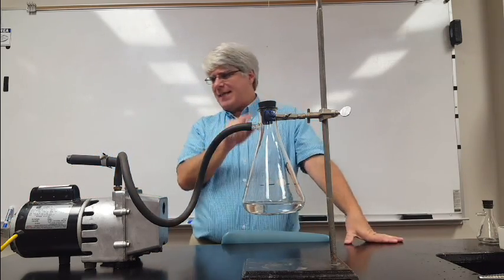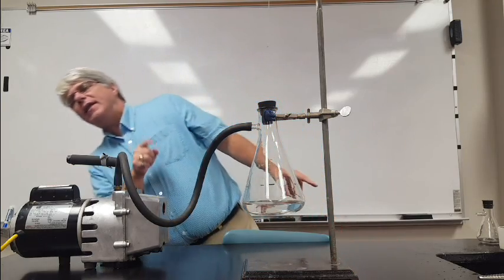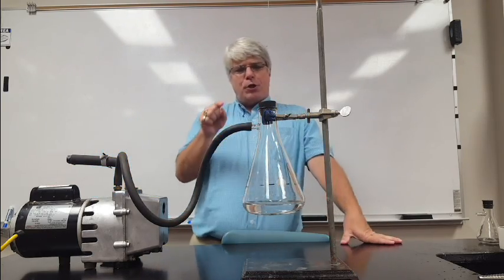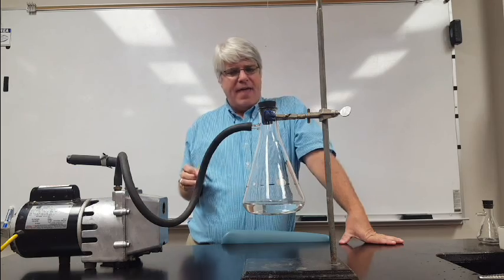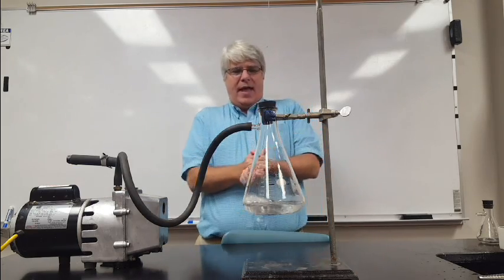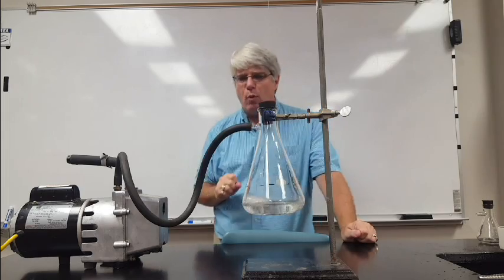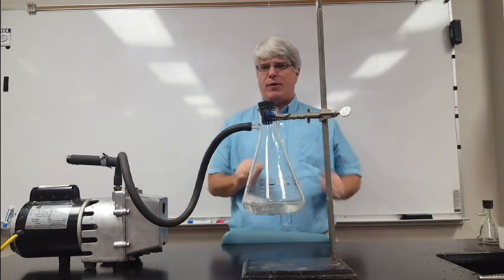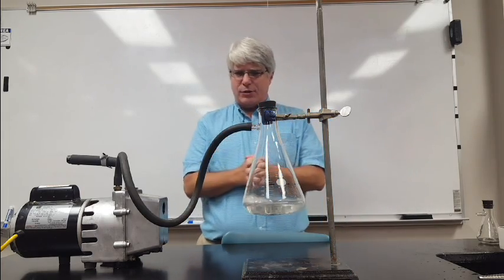Now the pressure inside that flask is going down. When pressure goes down, that means more and more vapor can escape. And eventually the liquid starts boiling. That's why the boiling chips were in there. Makes this boiling process a little easier.